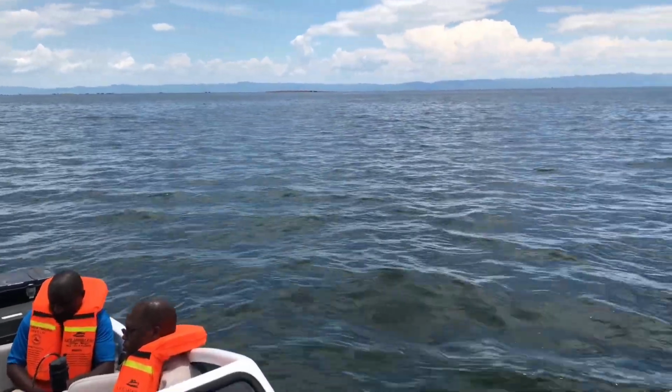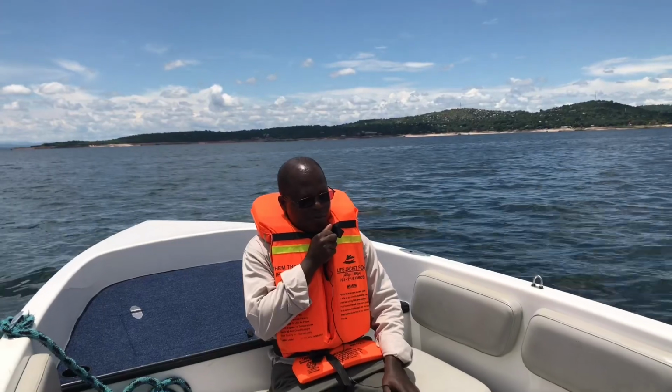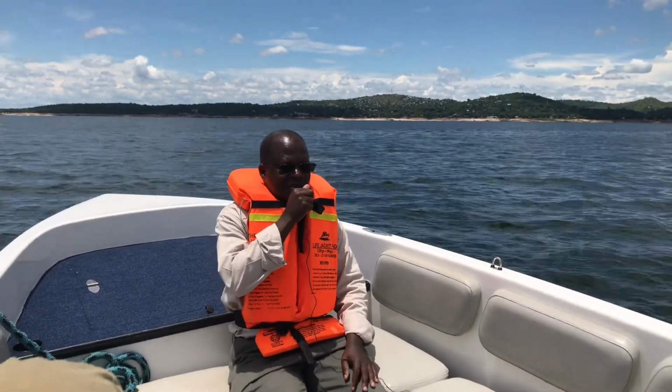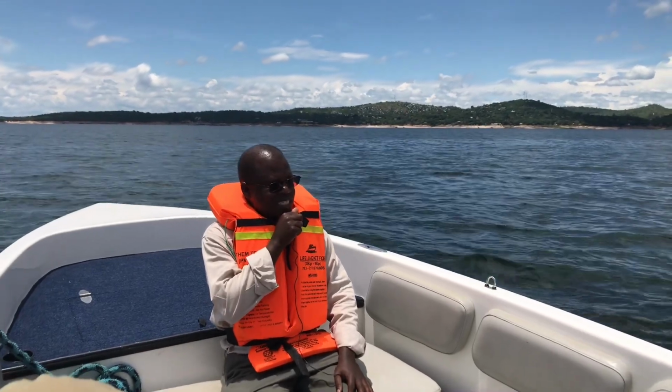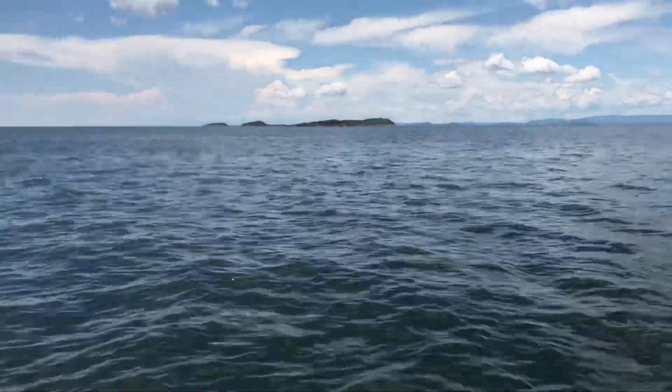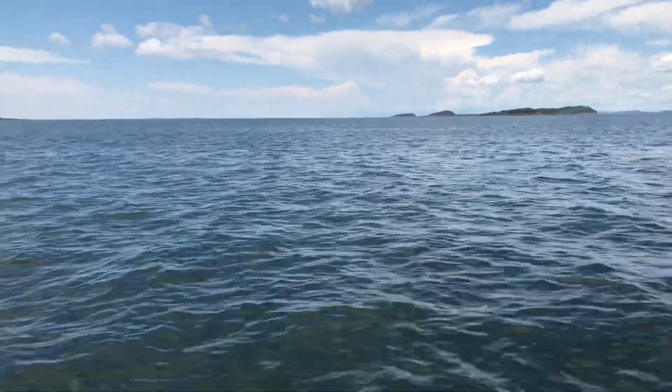Thank you so much for being with us. We are just coming from D51 where we are doing our water quality sampling. We passed through Machinchi Bay Station. We sampled there just a spot sample from 0.5 meters.